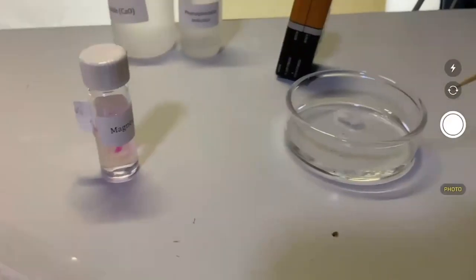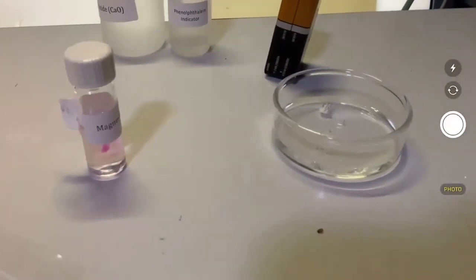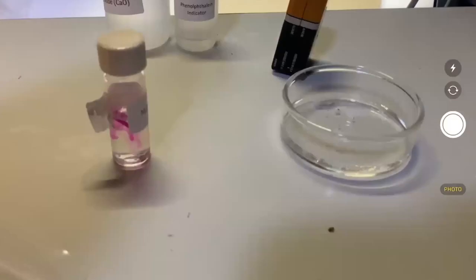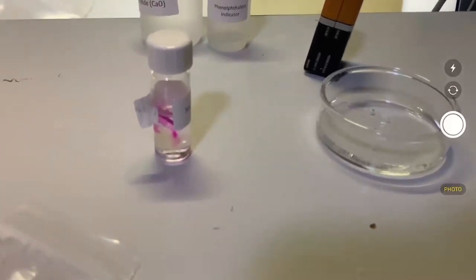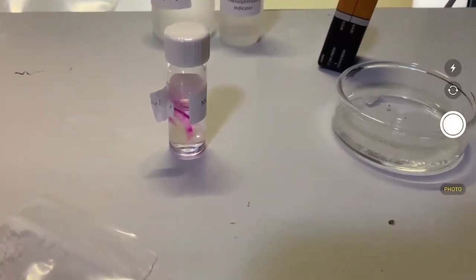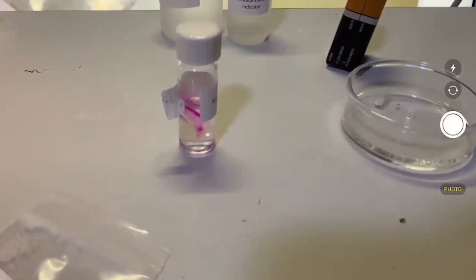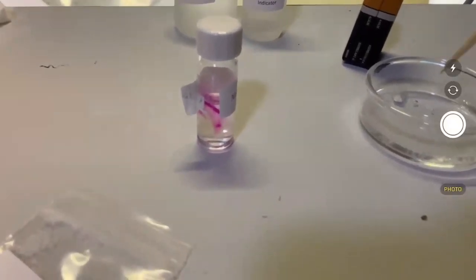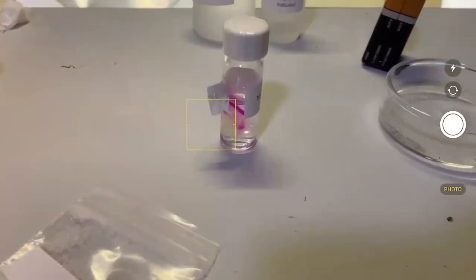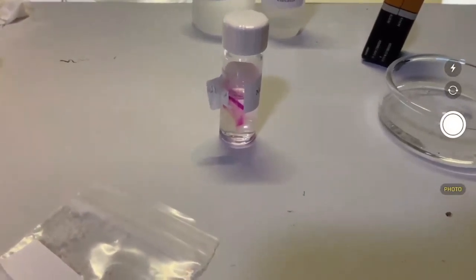That's all you want. You just want to see the evidence. So on the one hand, with water, it turns pink. On the other hand, with vinegar, it's bubbling. So we don't need hydrochloric acid. Hydrochloric acid would be overkill. We need common chemicals that you guys find in your kitchen. And you can see that thing is really bubbling. So that's it. That's your reaction. There's a lot of bubbles. I didn't realize that reaction would be so efficient with acetic acid.